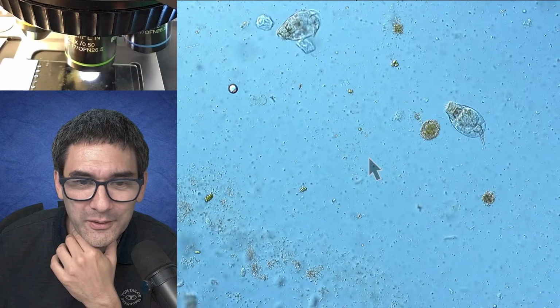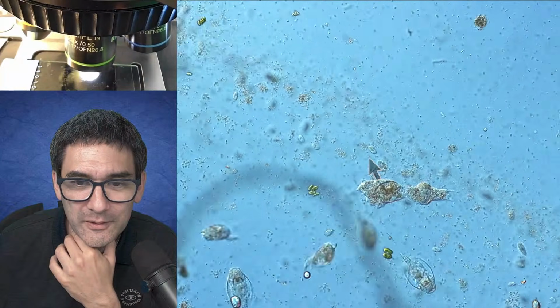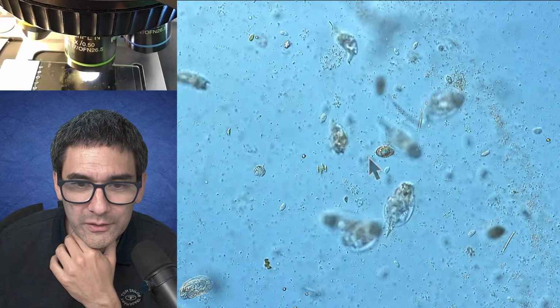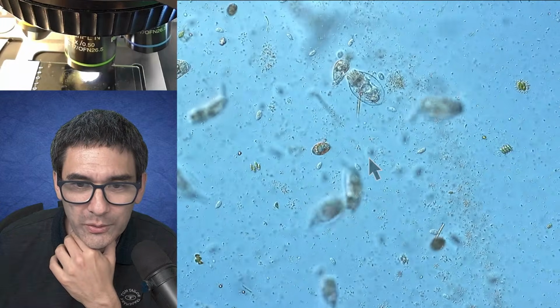Yeah, here we go. So the front goes on, continues over here. Oh, there is quite a bit going on here.